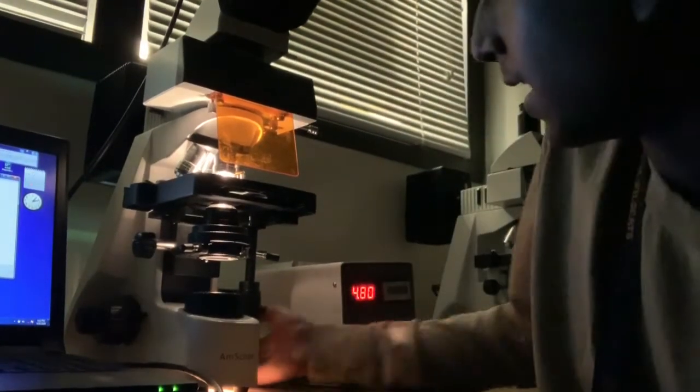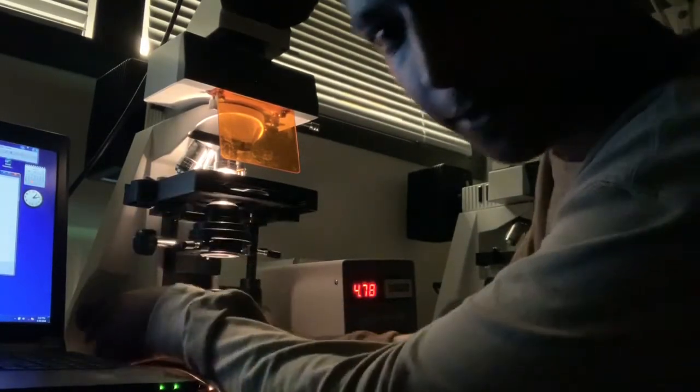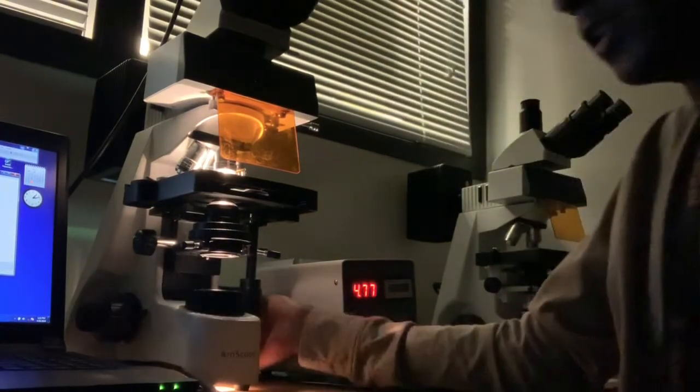When you're just starting, I'd recommend using the regular light. And obviously when you find your specimen, try to use the knobs on the side right here: the big one if you want to make big adjustments, the small one if you want to make small adjustments, to focus on your specimen. You want to have the clearest picture through the eye holes in order to have the best photos. So do that before you do the exposure and the gain.